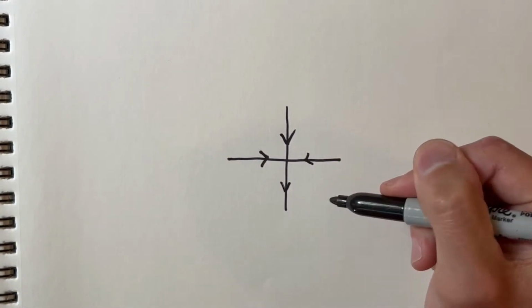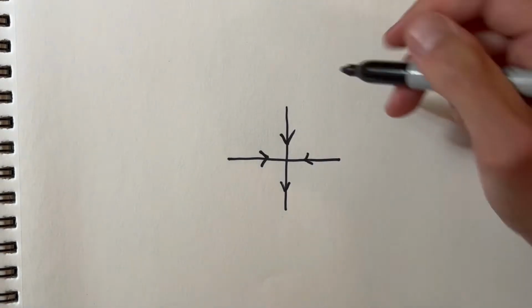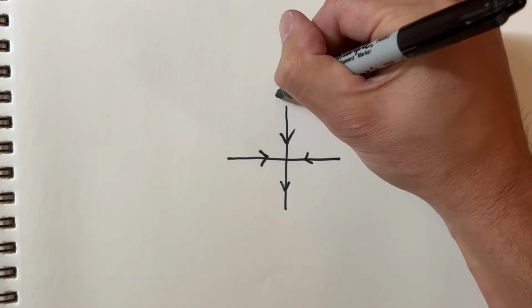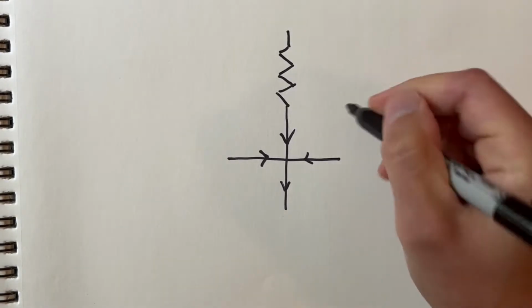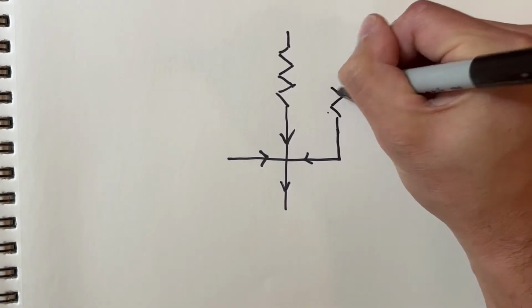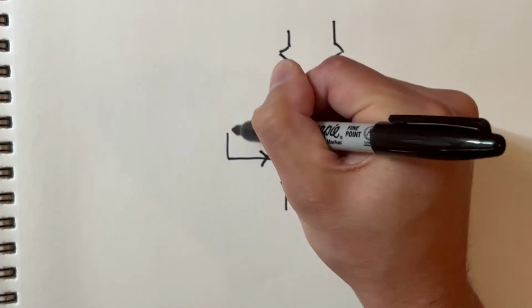Now, we know that we want a little bit of fluid resistance leading into the cross junction, so we end up with the proper flow rates at reasonable pressures. I'll just represent that by drawing a little fluidic resistor in the center. And the same thing on the side channels. I'm not a great artist, but that's okay because this is just a schematic representation of the device that we'd like to make. And it's going to make our lives a lot easier when we do make the jump to CAD.